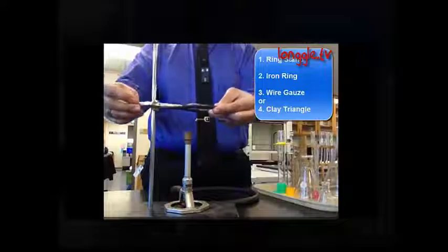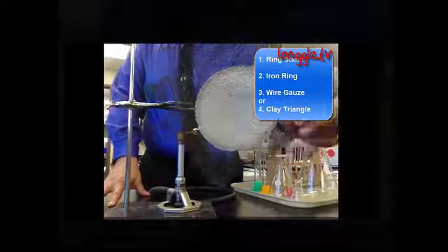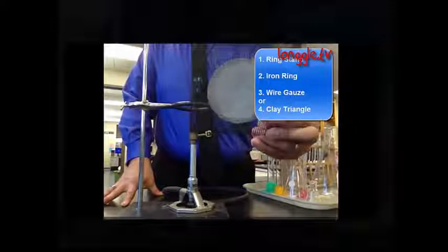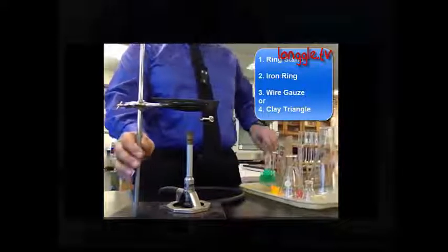It clamps right on here. I can put the Bunsen burner right underneath it. And then if I want a platform or something, I can use, for example, this. This is called a wire gauze. It's made out of wire. It has this asbestos circle in the center that allows us to heat evenly. And I can put the wire gauze on top of the iron ring, and I get a very nice little cooktop.